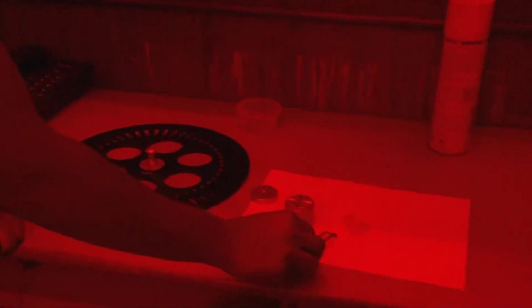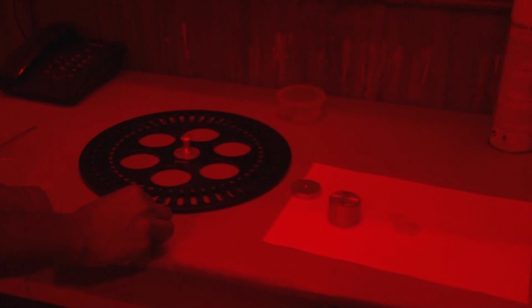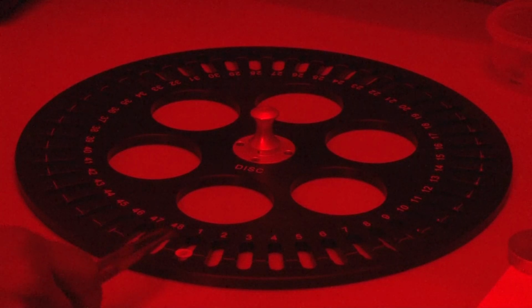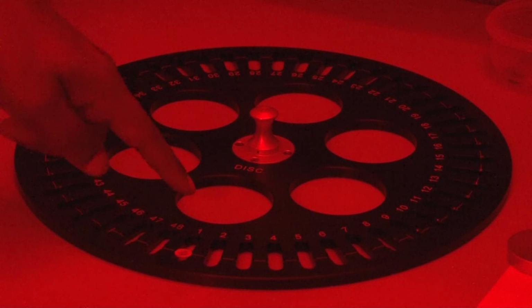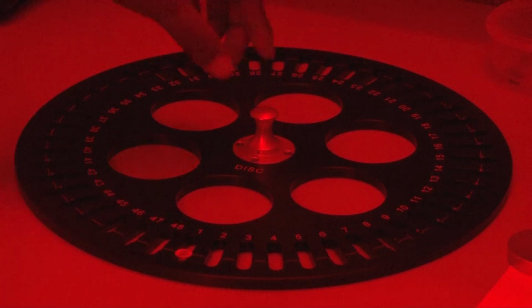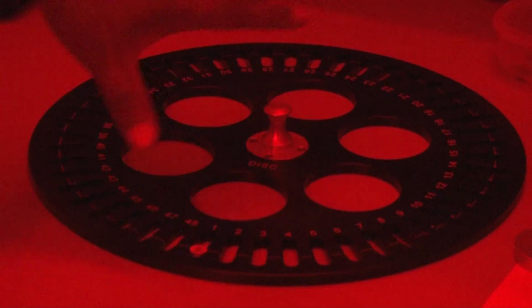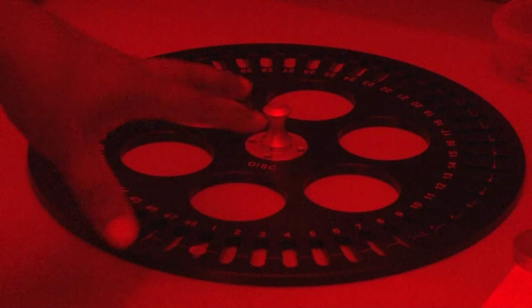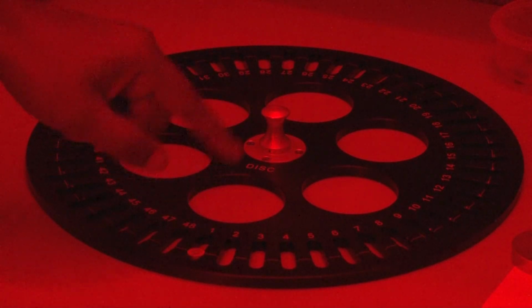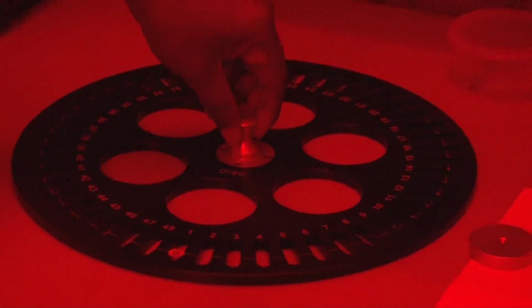So we will put this sample on position number first. Here you can see I have put this aliquot on the first position. Keep this first position in mind, because when we use the sequence editor on the PC, we will assign the system that we are going to run this sample on the reader. So we will perform all the protocol on position number first only, because all the other parts are empty. So we will not use that part.